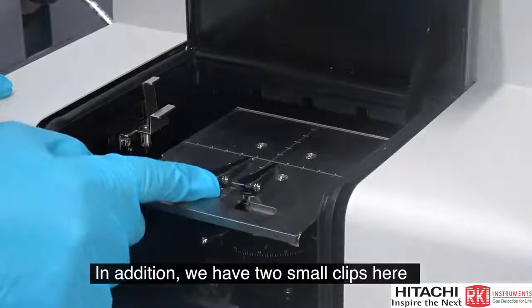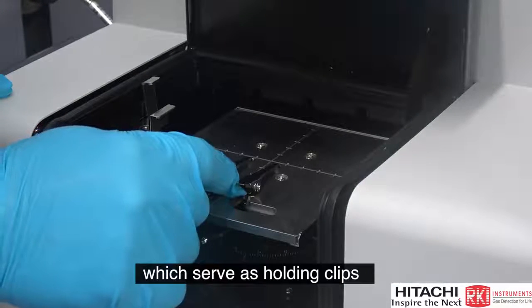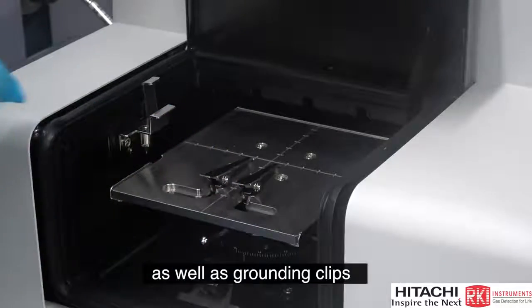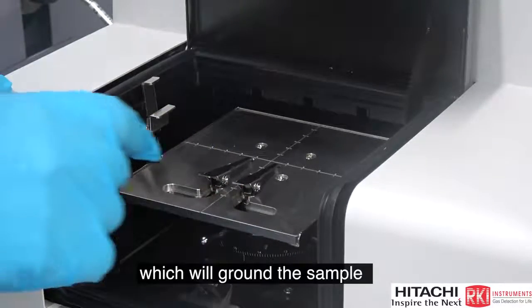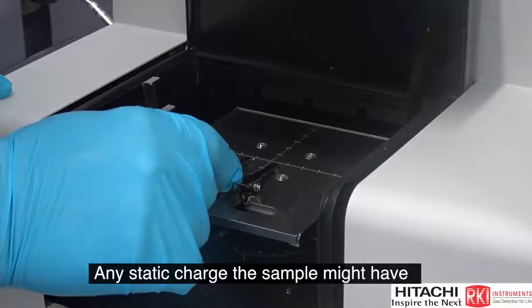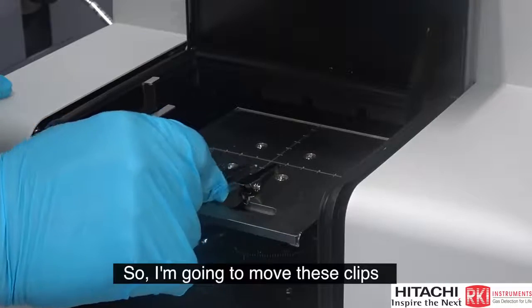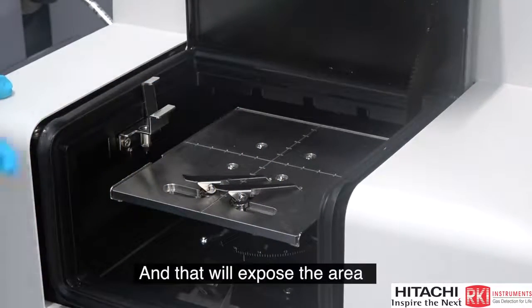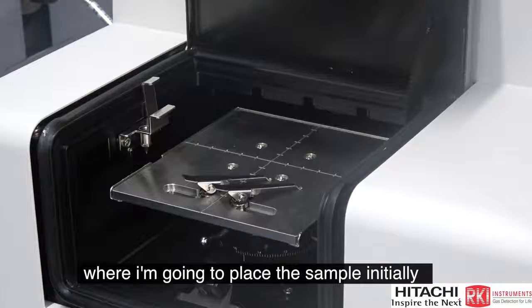In addition, we have two small clips here which serve as holding clips, which will hold the sample down, as well as grounding clips, which will ground the sample, freeing it of any static electricity or discharging any static charge that the sample might have. So I'm going to move these clips out of the way just for the moment, and that will expose the area where I'm going to place the sample initially.